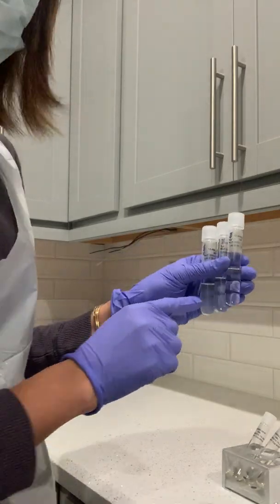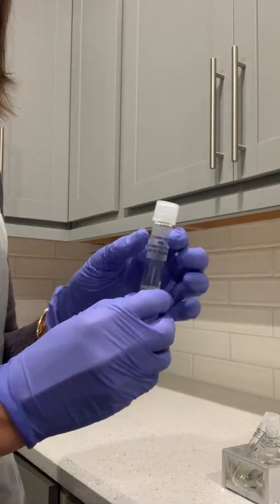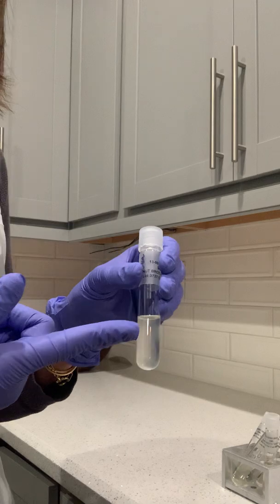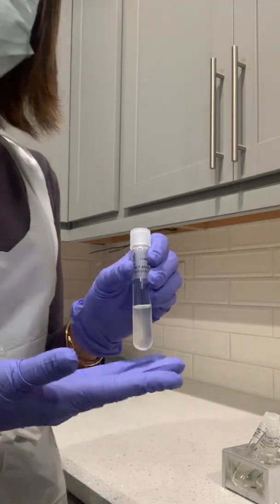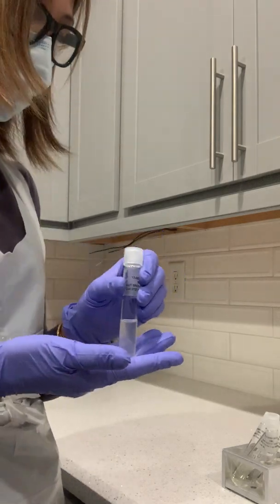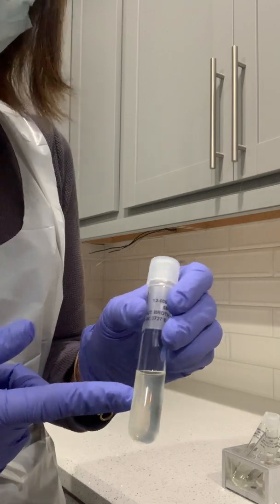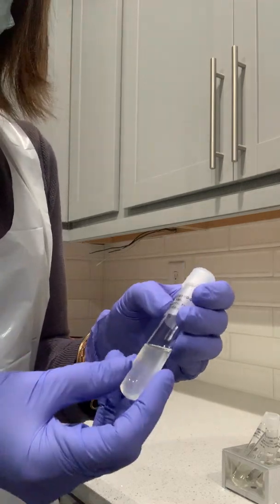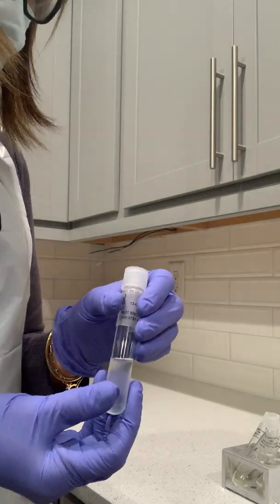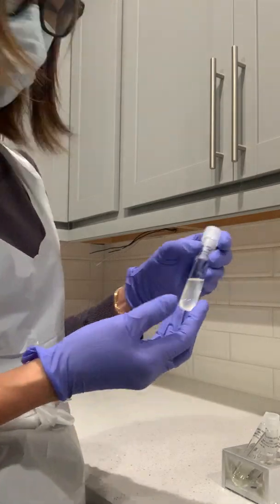On the first one, this is the 1% sodium chloride, and I see some growth there because it's turbid. From my experience it's salt sensitive, but it shows some cloudiness at 1% sodium chloride. I'm not sure why it did that, but it is salt sensitive, not able to adapt in hypersaline.